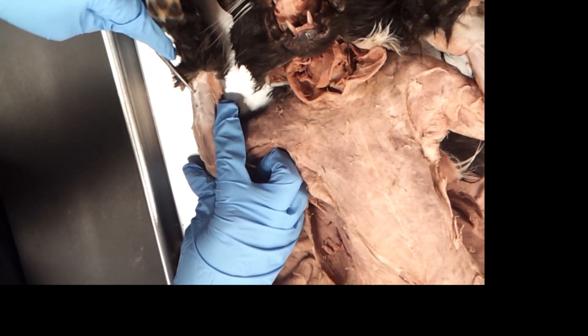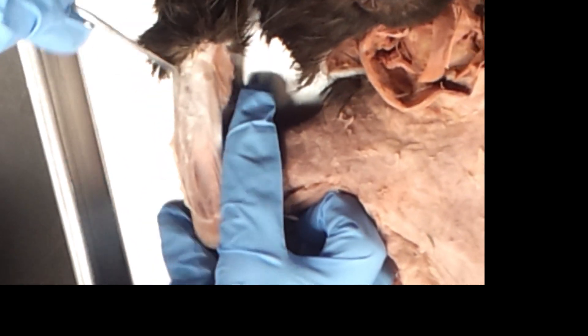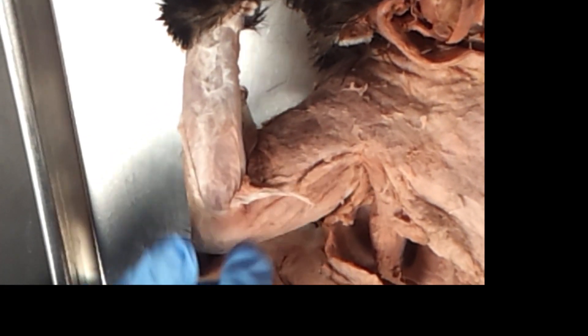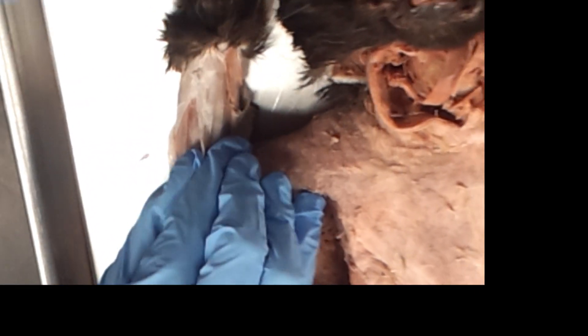When you see the actual muscles — think about it, you've got all these tendons going into the palm of your hand. So each layer of wrapping is going to end in a joint. And it sounds just like jerky when you rip it.